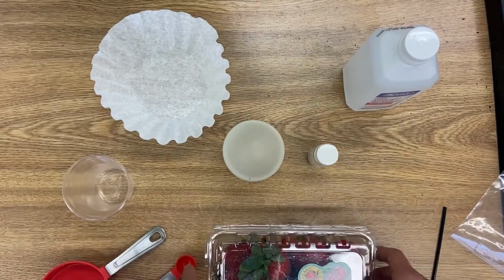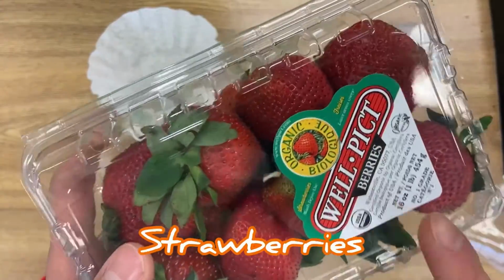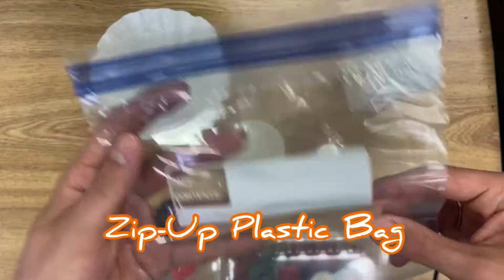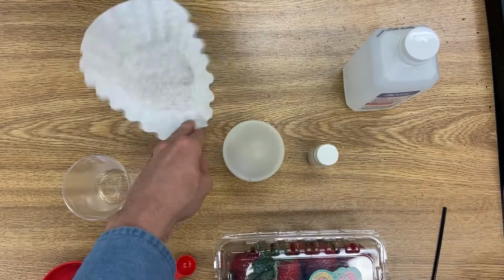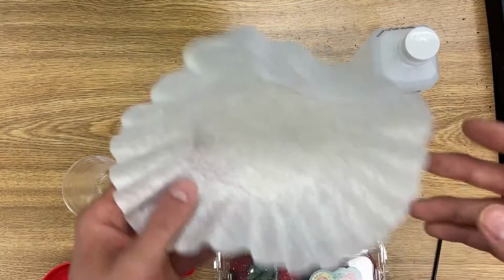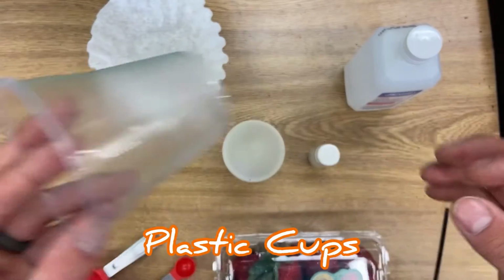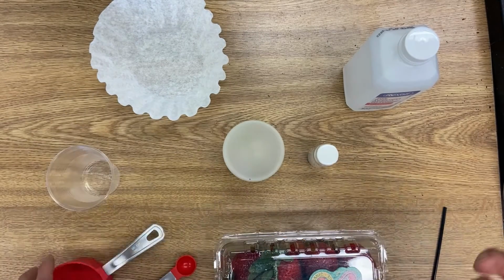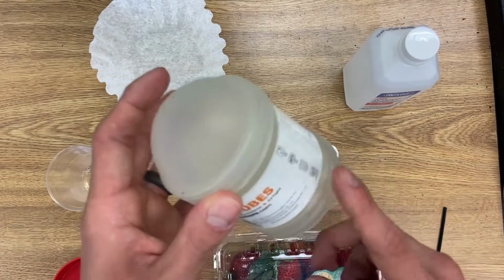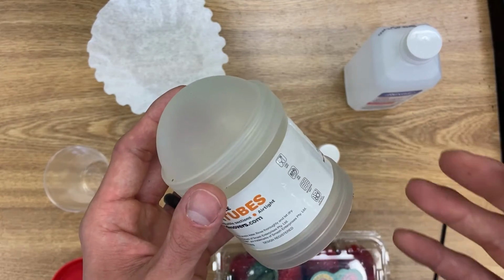So let's take a look at all the supplies we will need for our experiment. So obviously we will need our strawberries, a plastic bag, a coffee filter, a plastic cup, and we also will be using half a cup of water, 2 teaspoons of dish detergent, and this is going to help dissolve the cell membrane, which is a lipid bilayer.